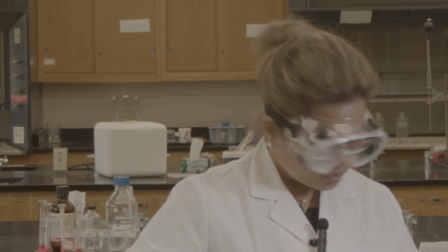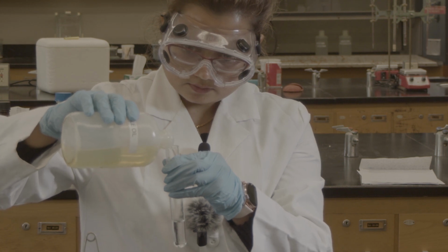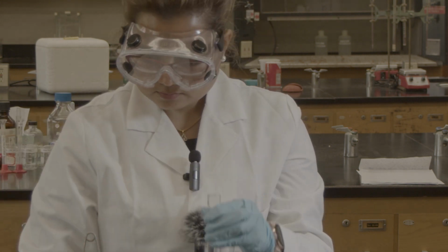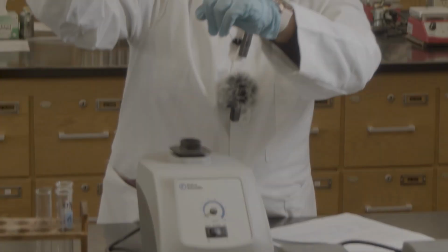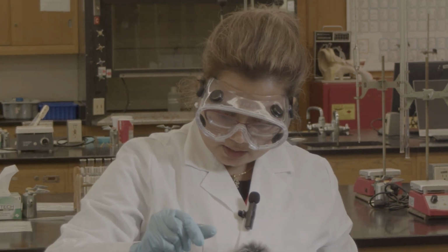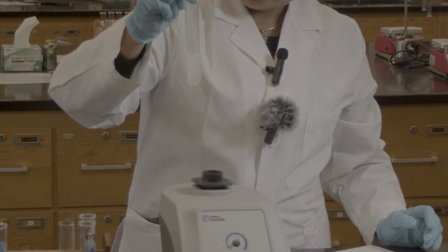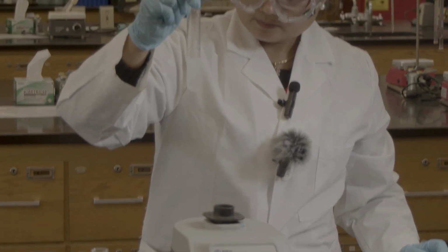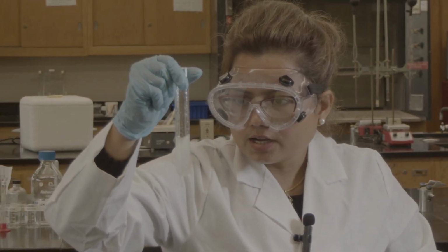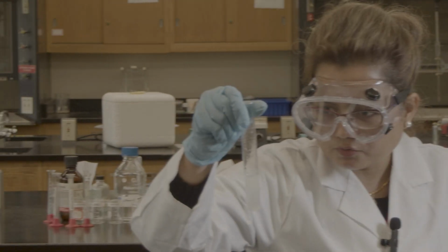Now I will do the oil. So you can see it's totally clear. Oil is never soluble in the water. You can see a layer, but still I'm going to mix it up. It doesn't dissolve, so I should wait to see whether the layer comes out or not. So I will come back to this.